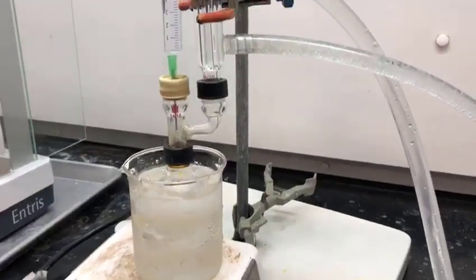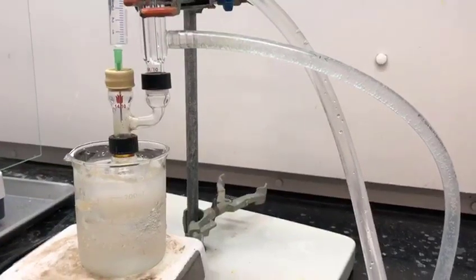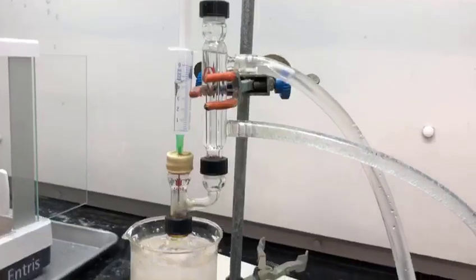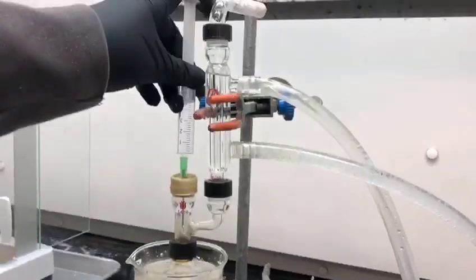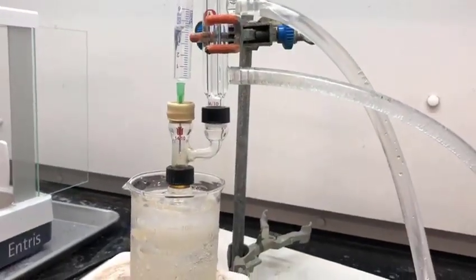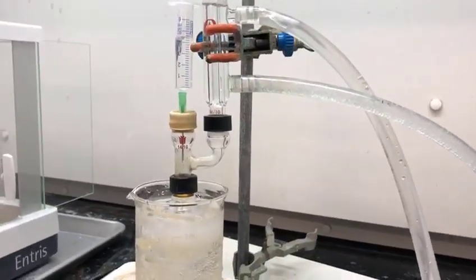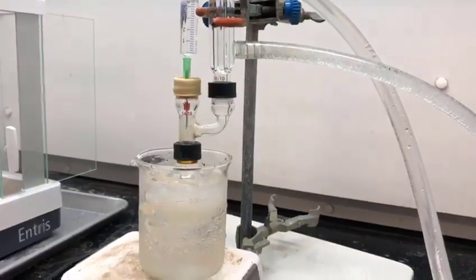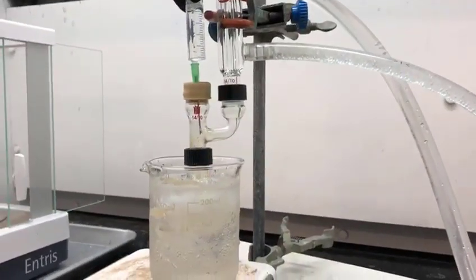This step is important. Our sodium borohydride reaction with the alkene — in this case specifically hexene — is quite reactive. We do want to make sure that we deplete or degrade any unreacted sodium borohydride, and that is what the water does. Upon that reaction, it actually generates H2, hydrogen gas. The bubbles that are formed — which the TAs were able to see — that is the H2 gas evolving from quenching the sodium borohydride.